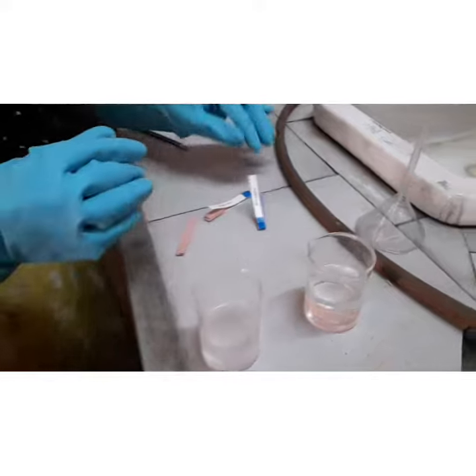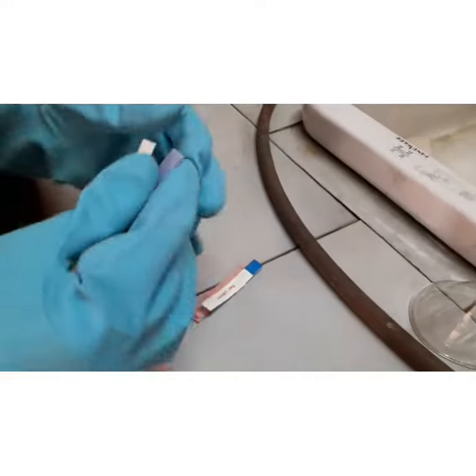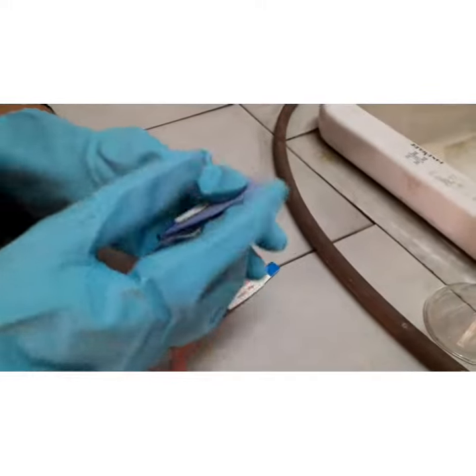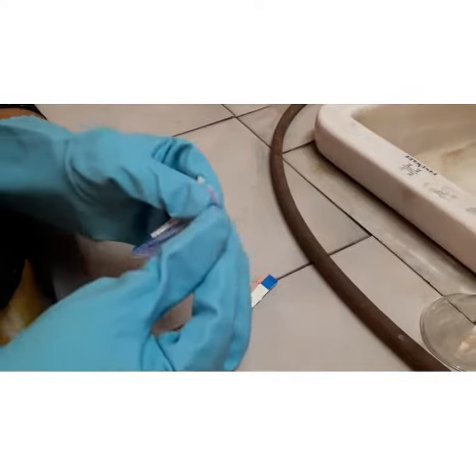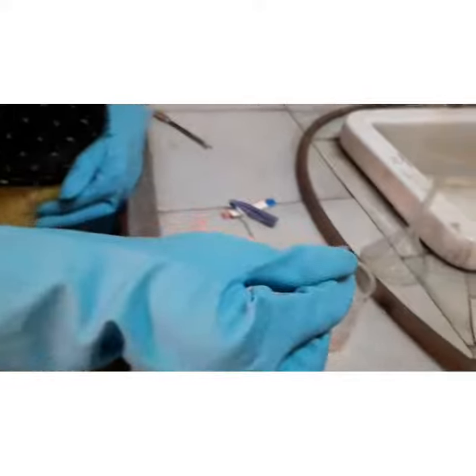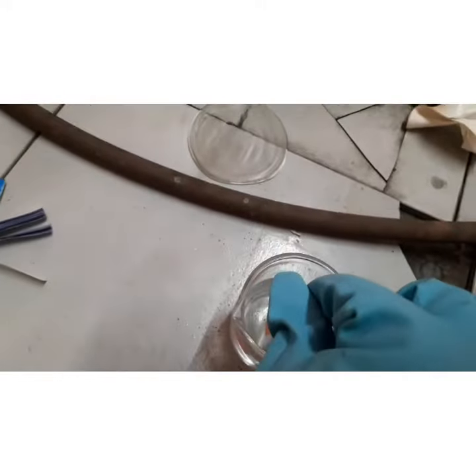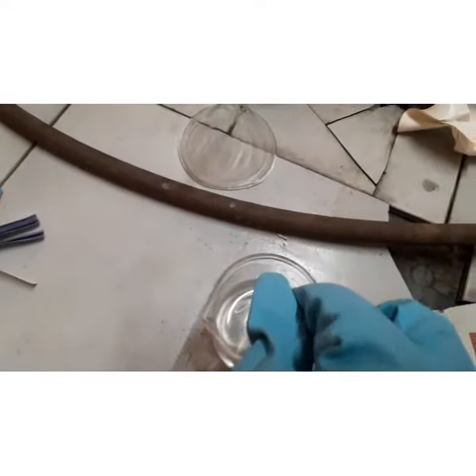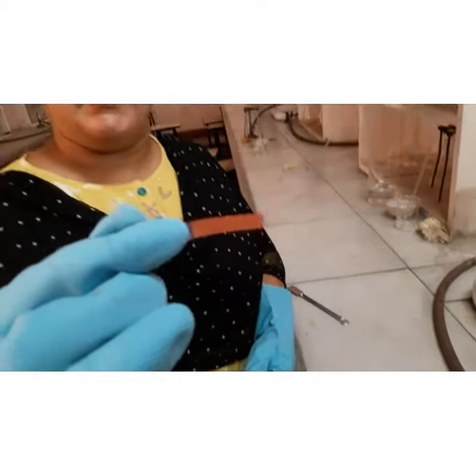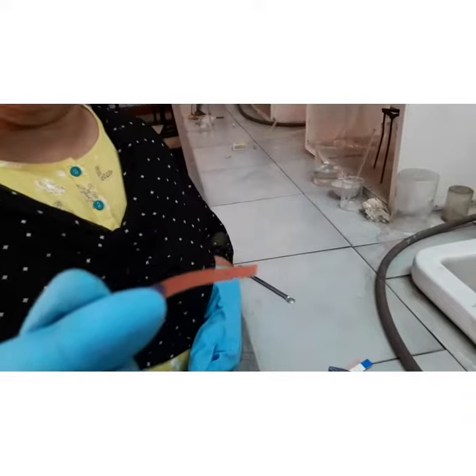Now we will use litmus paper. We have used a blue litmus paper and will dip it in acid. See the litmus paper — the color changes to red. Red color means acid.